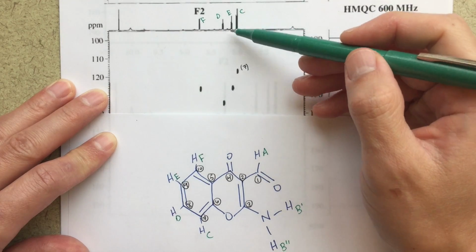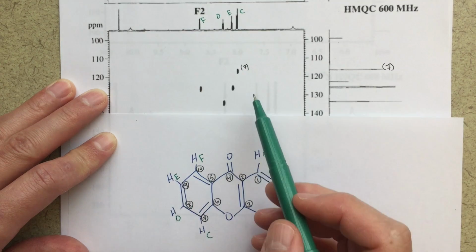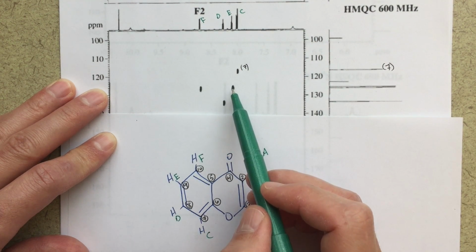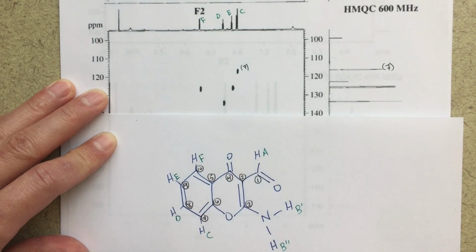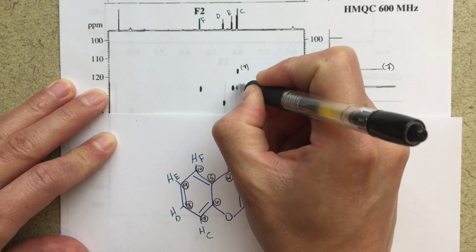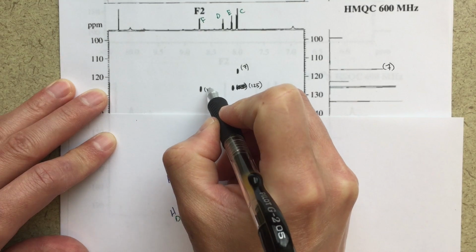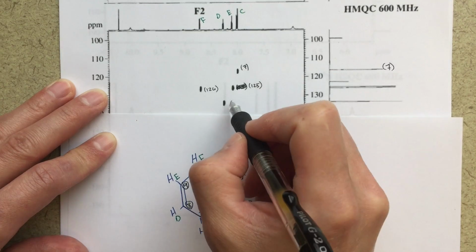Now for E, that corresponds to this proton and carbon number 9. And if I look at this, these two carbon peaks are very close to one another. So I looked very closely at these, and this one looks to be slightly higher up, a little bit higher than this one over here. So I said that this one was probably the 125. Let's make it so it's legible. And that this one was the 126. And then this peak here comes at 134.